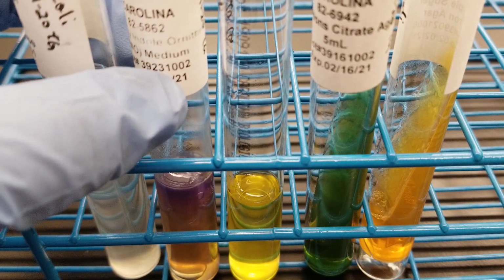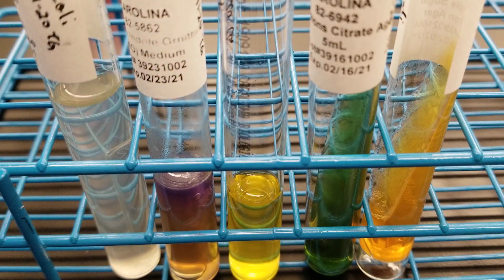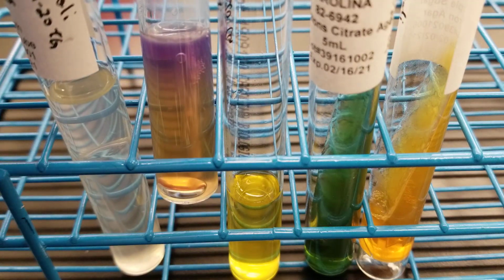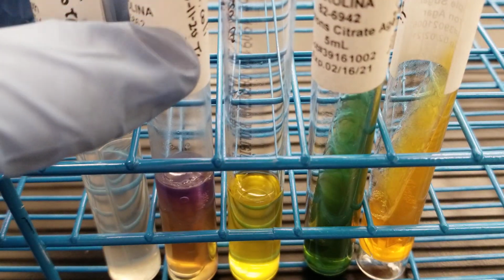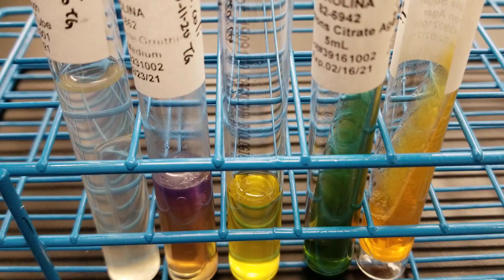The MIO tube is very different also in regard to the bacteria can be either variable positive for motility and variable positive for ornithine. And it looks like our ornithine honestly is negative here. I haven't done the indole yet, but again, this is E. coli. So E. coli is MIO variable positive, positive, variable positive, whereas Enterobacter aerogenes is positive, negative, positive. So in these ones that we currently have, there is a variation there, and they're not going to be exactly the same.